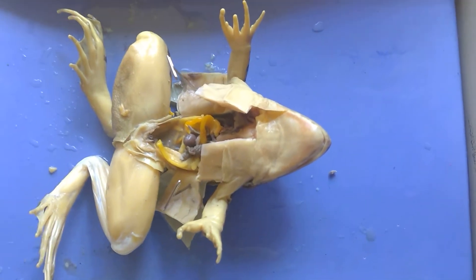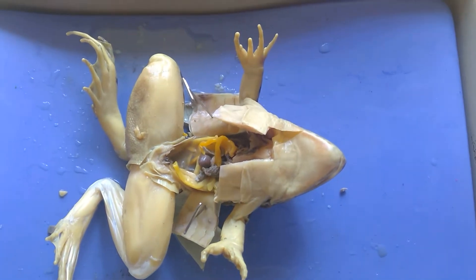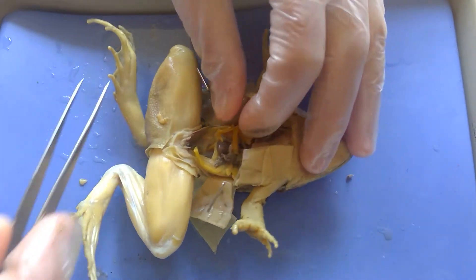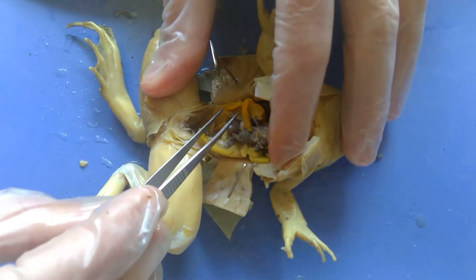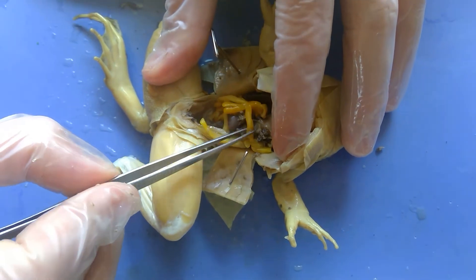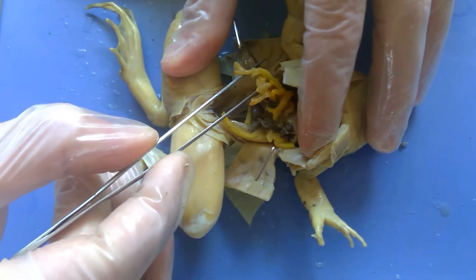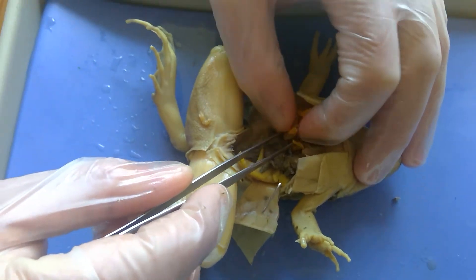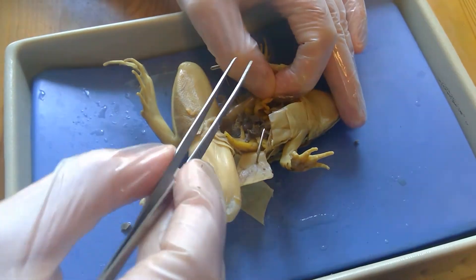Now we're going to do the urogenital system of the frog. The first thing we want to figure out is whether this frog is a boy or a girl. The main landmark I use for this are these things here called the fat bodies — we'll talk about those in a second — but I'm going to move them back out of the way and look inside.